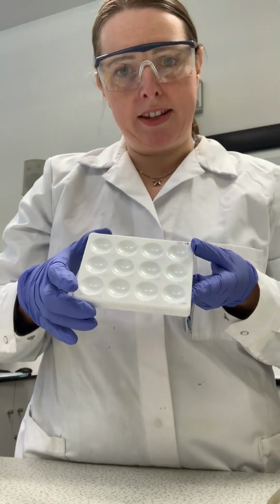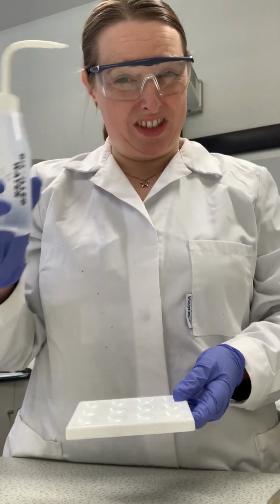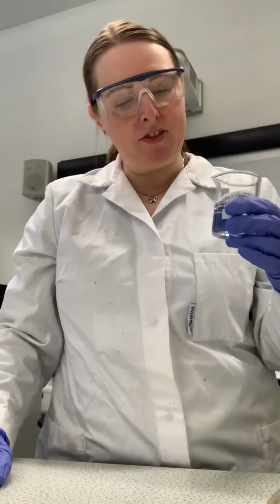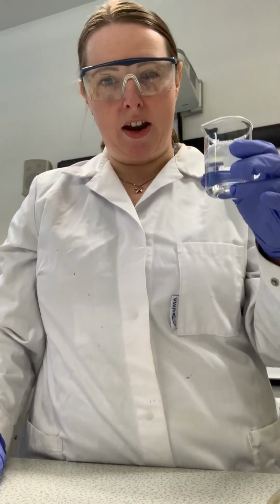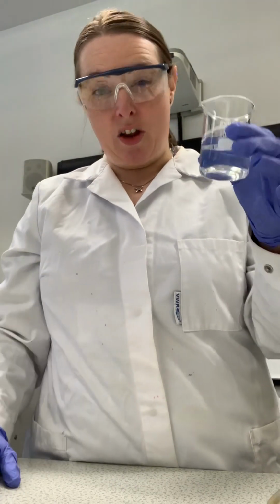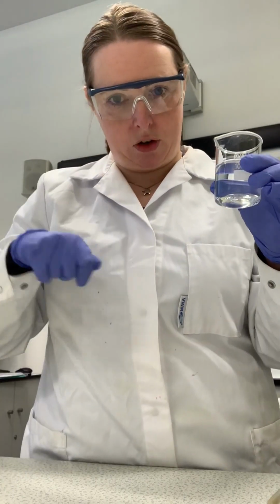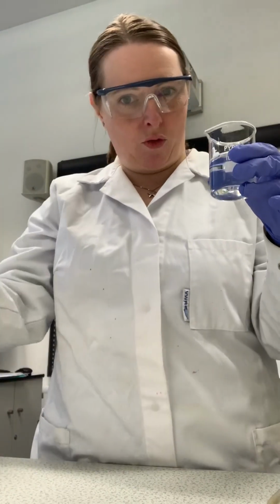So what I'm going to do in my tile is I'm going to have a negative control, which is water. So this should be a negative result. And I'm going to use a known starch solution. Now, if you think back to our lectures together, starch is a polymer, polysaccharide, very hard to dissolve. We have a starch solution, and that's because we had to add the starch and boil it vigorously and stir it lots to get it into solution. This wouldn't happen in a normal potato just in the ground.